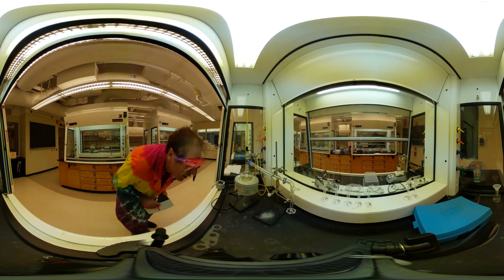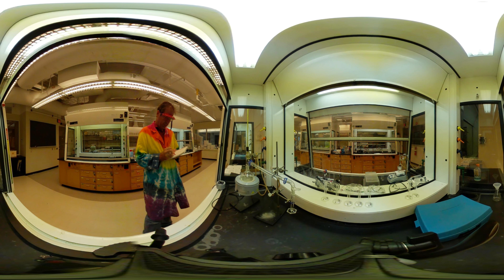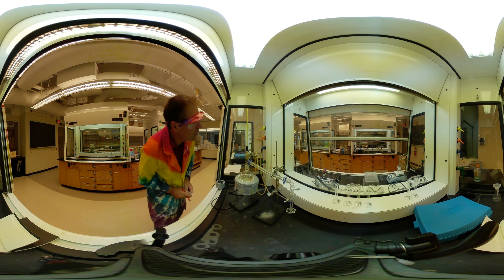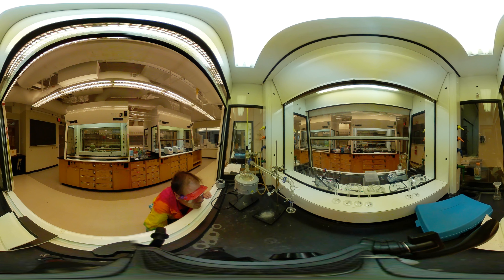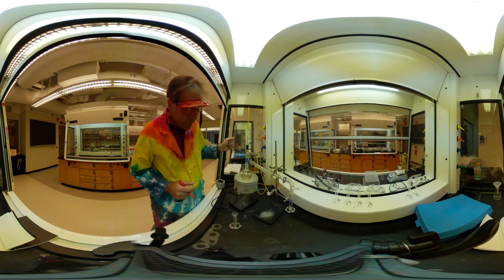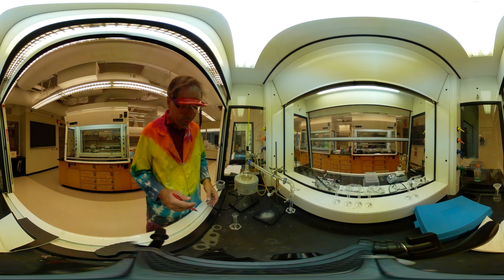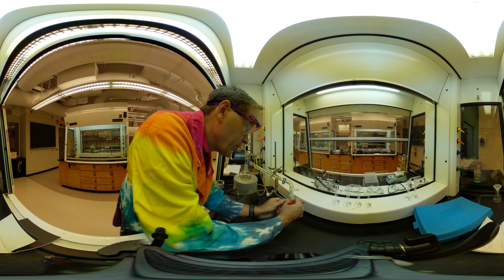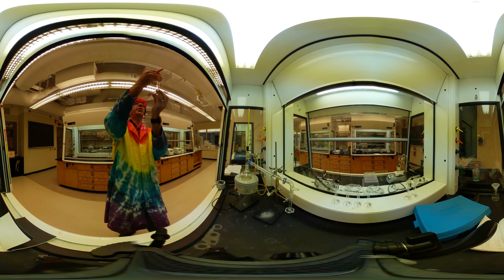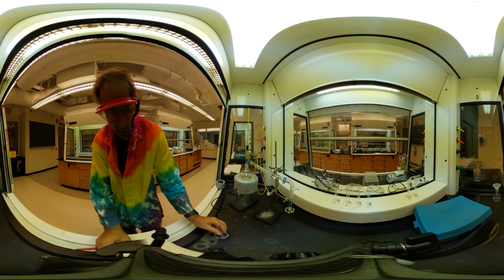Make sure that's all nice and tight. We can do this about every milliliter to milliliter and a half. I'm going to get my second graduated cylinder — make sure it's the second one. Slow it down — I still see it condensing up in here, still getting some drips. We don't want to go too fast or we can't get good data. So we're going to swap this out now. We are at the milliliter mark and our temperature is recorded. Going on to the next fraction now.